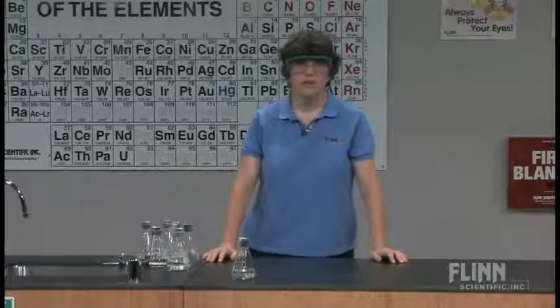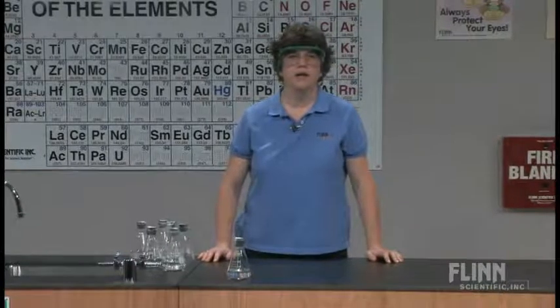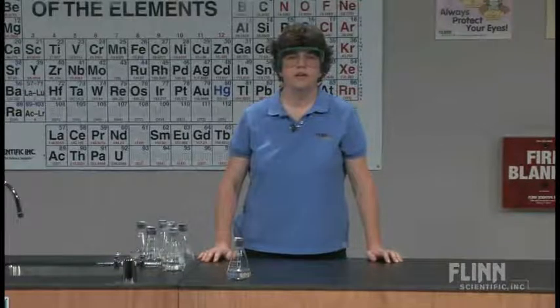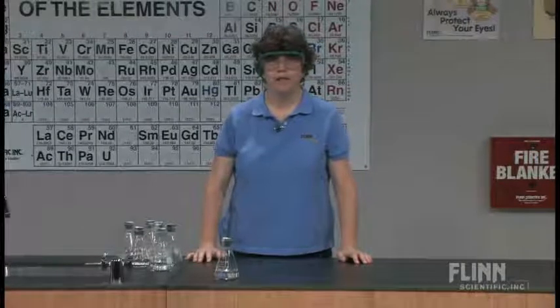I find this a good way to show students another way to tell the difference between intermolecular forces. We talk about viscosity — the swirling shows viscosity very well. We can discuss the difference between different amounts of hydrogen bonding and different numbers of carbon atoms, even with dispersion forces. I like this one a lot. Thank you.